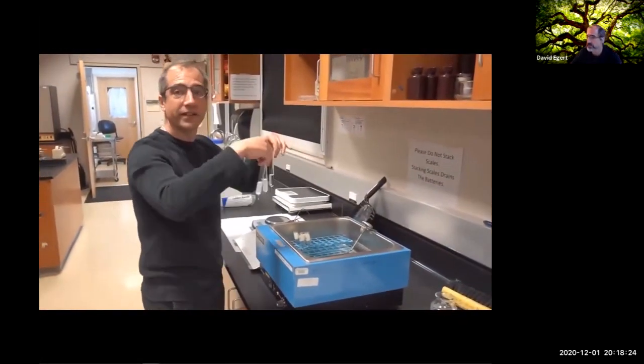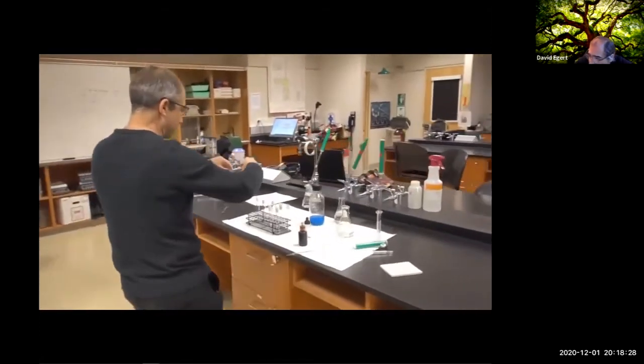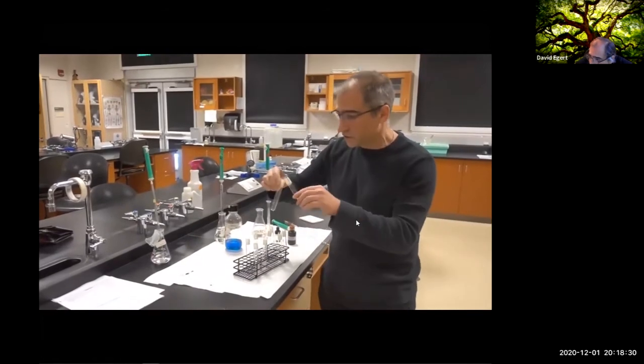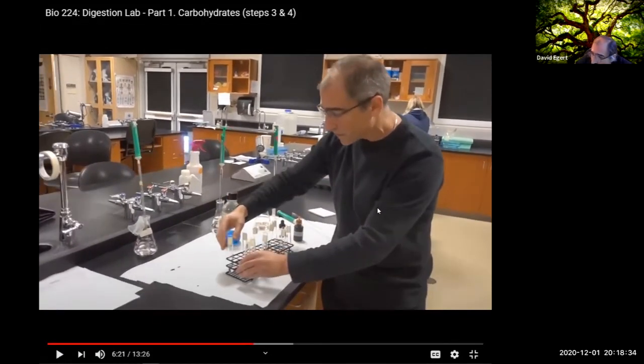All right, so these have been incubating at 37 degrees C, and now we can do our assay and see what the results are. All right, so each of these needs to be split into 2 roughly equal test tubes so we can check each sample both for starch and maltose. This is important. Since we're doing 2 assays on each tube, if you don't split it ahead of time, you're screwed, because all of a sudden you've added the iodine to one, and there's nothing left to add the Benedict's to.